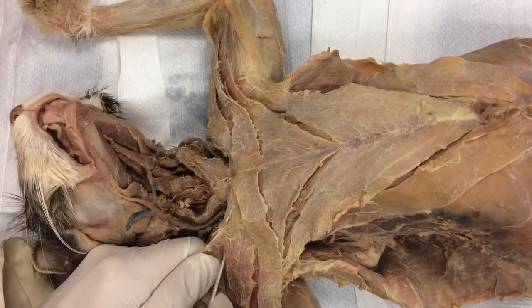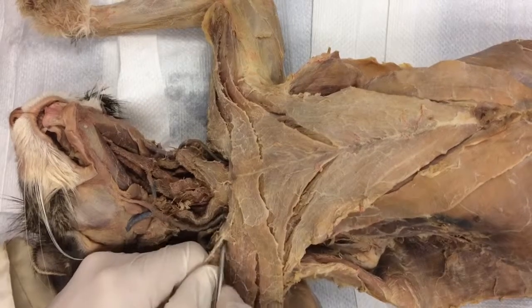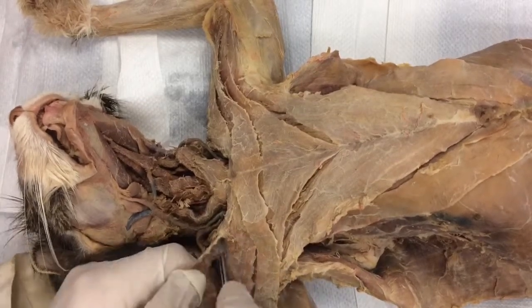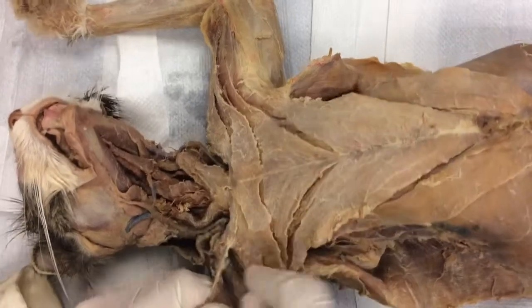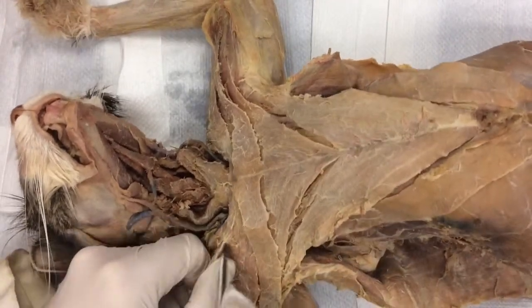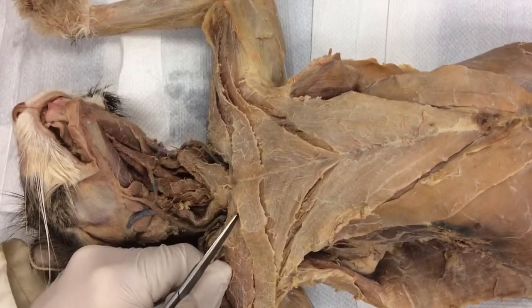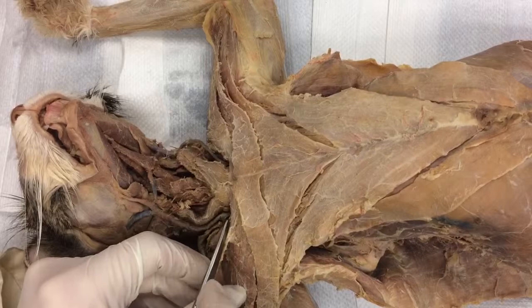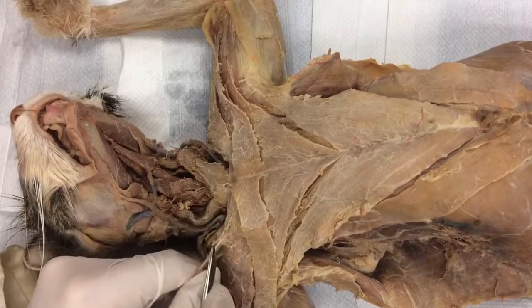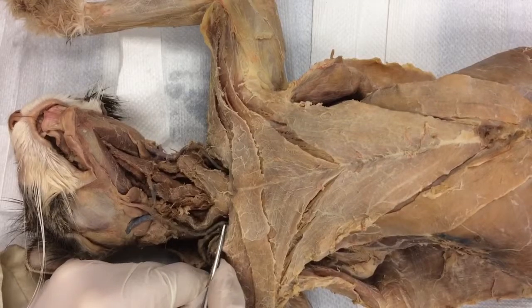If I flip this open, there's just a little bit of connective tissue separating the two. And if I close my scissors, this should come out — right in the neck. I'm not quite there yet, so I'm going to keep good pressure. That line is right in that groove right there. I'm going to slide the sharp side in and just close it.